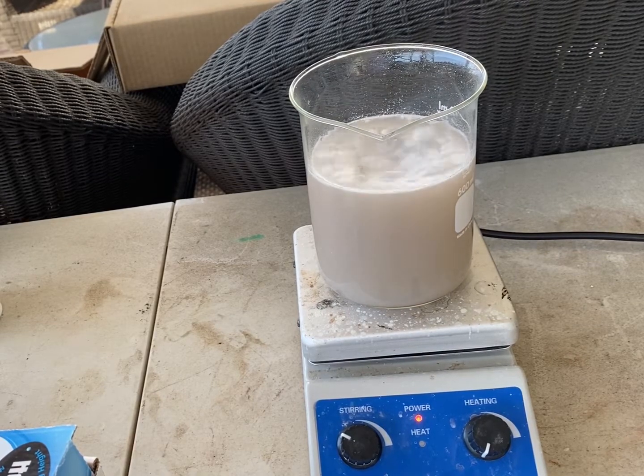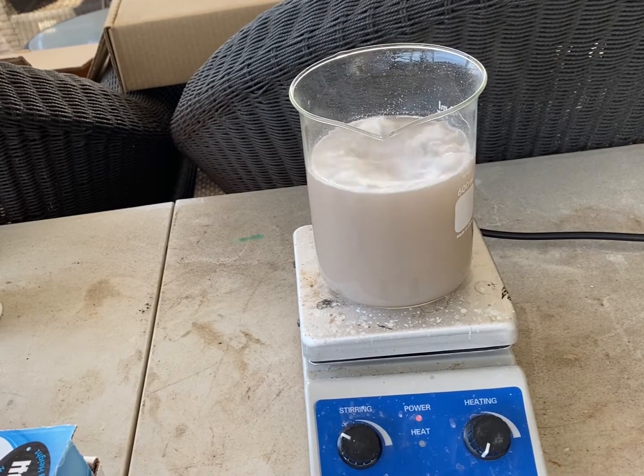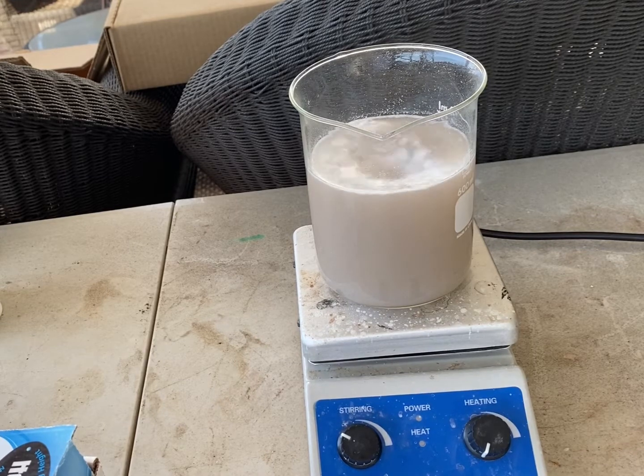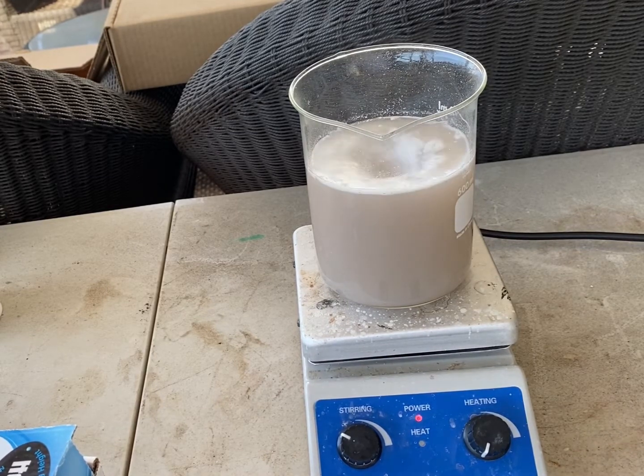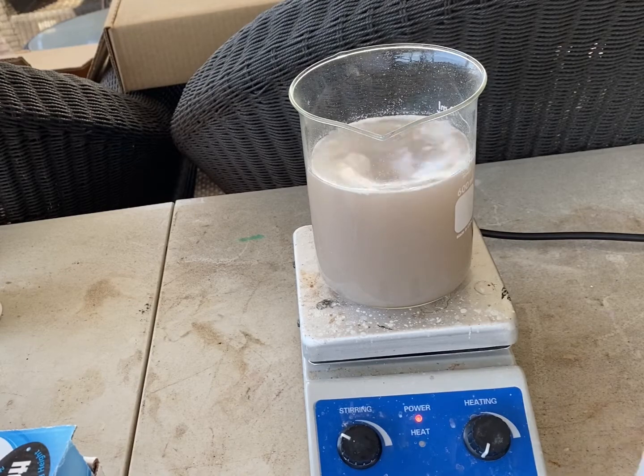As you can see, it gets pretty pasty at the top. So, I'm going to add it all, and if anything interesting happens, if there's a color change, I'll document that and show you.